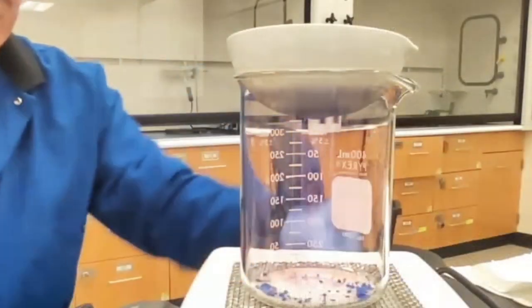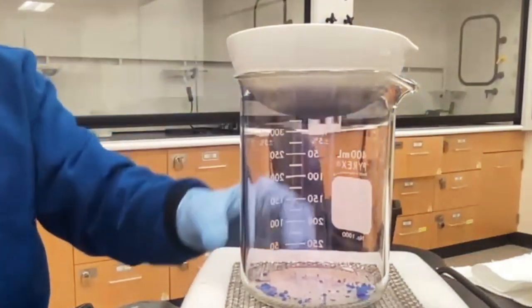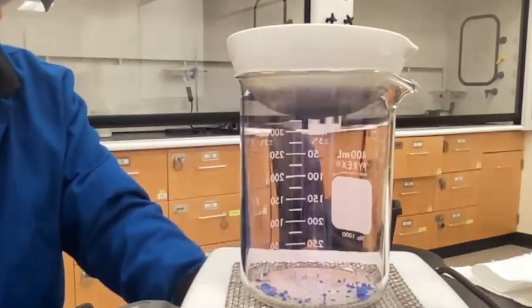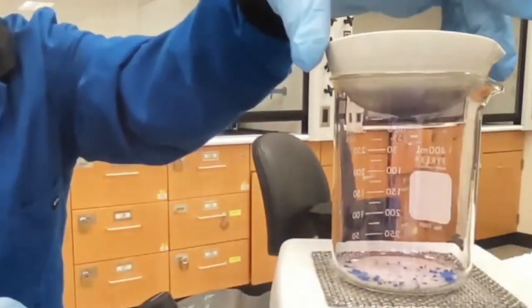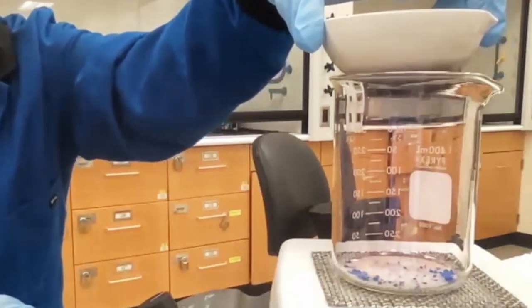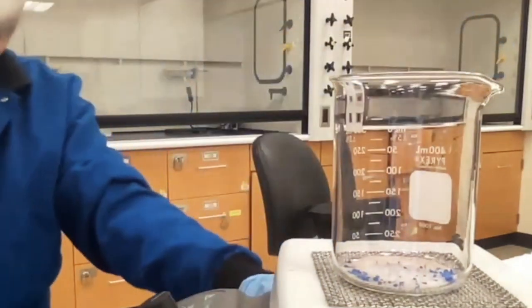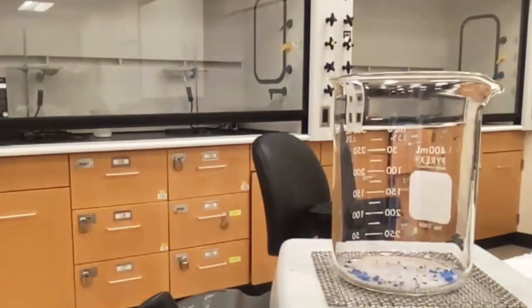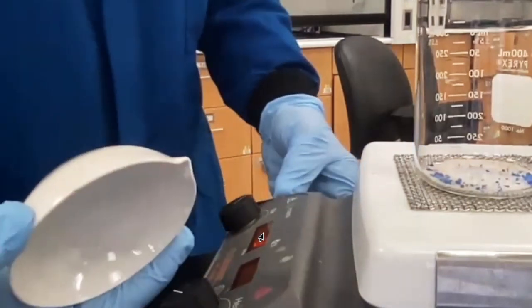Okay. So looks like we're done. It's pretty much clear and it's pretty much safe. So I'm going to turn off the heat. I'm going to use the hot plate again. But what I want to show you now is what you need to do is you need to remove this, and then you need to take another beaker and dump the water. Okay, dump the ice. So I'm going to do that. And then you're going to turn it upside down.